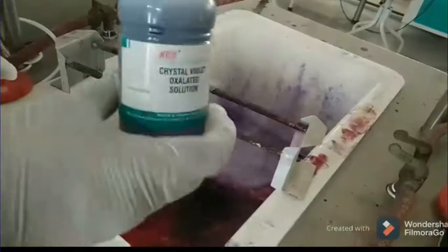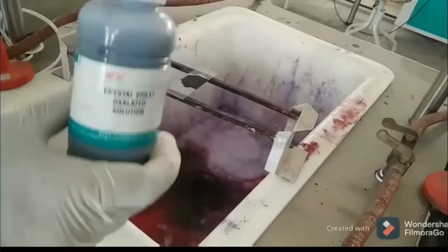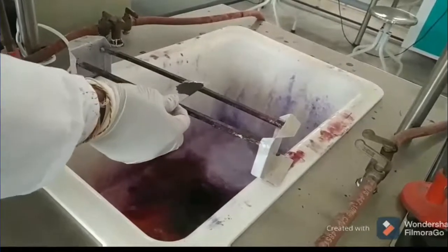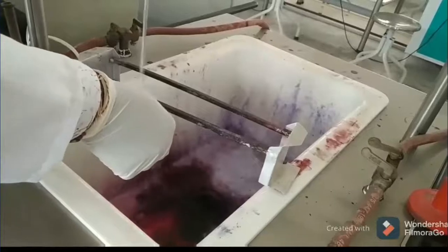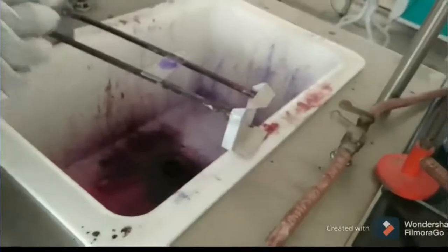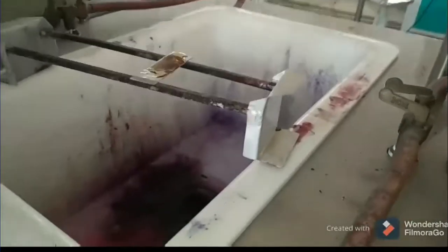For the first step, we pour crystal violet — the primary stain — onto the smear, making sure it covers the smear completely. Wait for one minute. All bacteria in the smear will take on a violet color. Then wash with distilled or tap water to clear the excess stain.